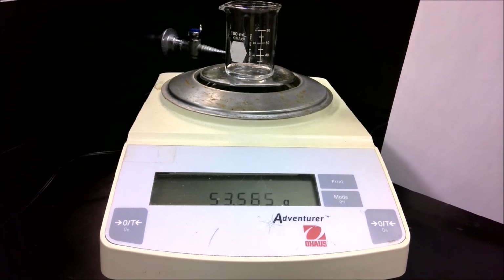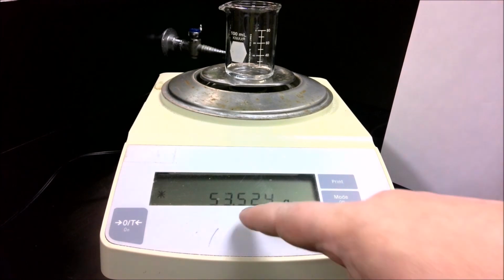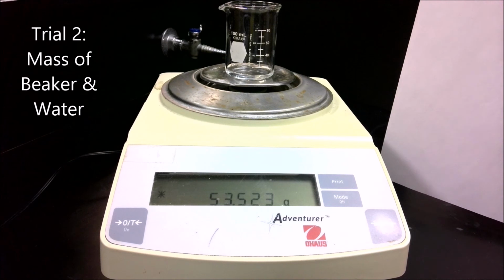Touch the inside of the beaker, get that droplet off. You can get the final mass of the beaker plus the water. So that should give you all the data you need to calculate the density of water twice and then calculate the average density of water.